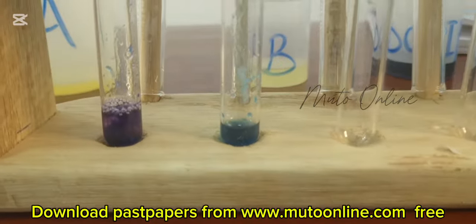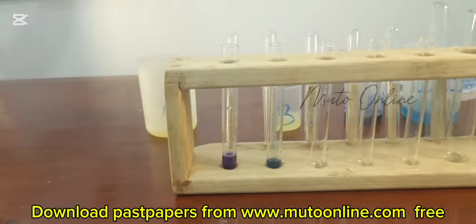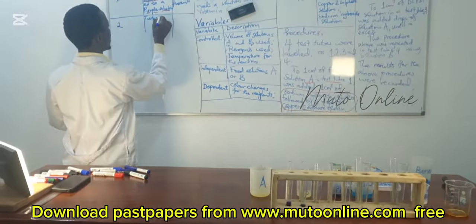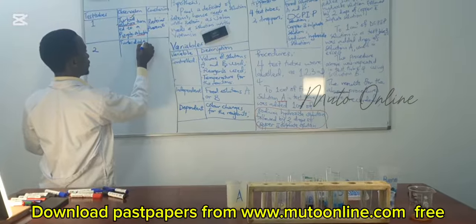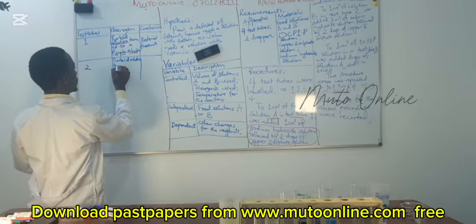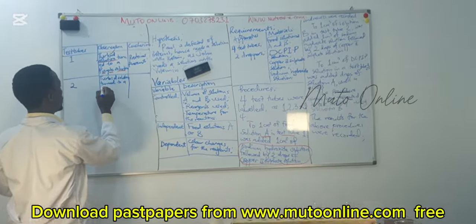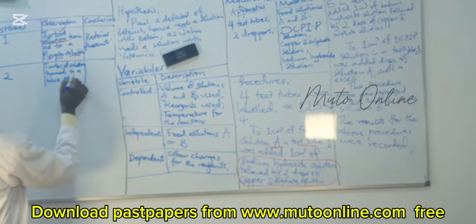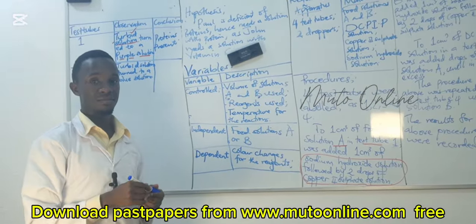So for test tube 2, the observation we had is a turbid solution turned to a blue solution.